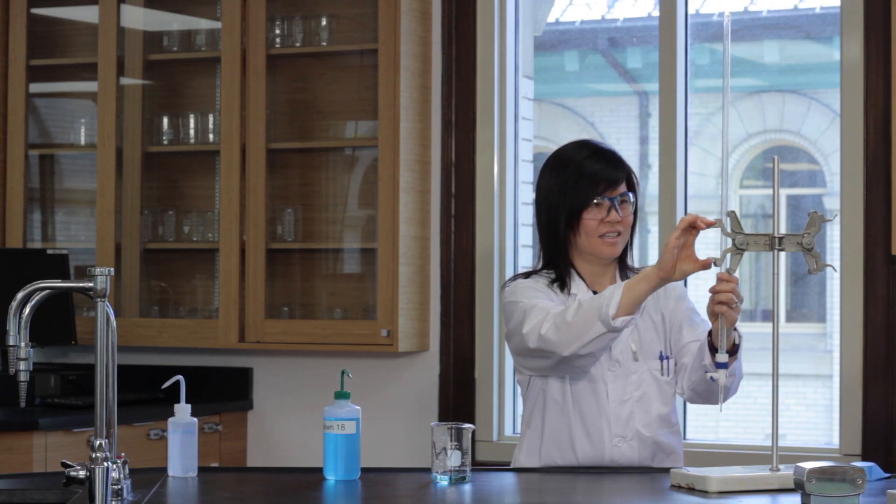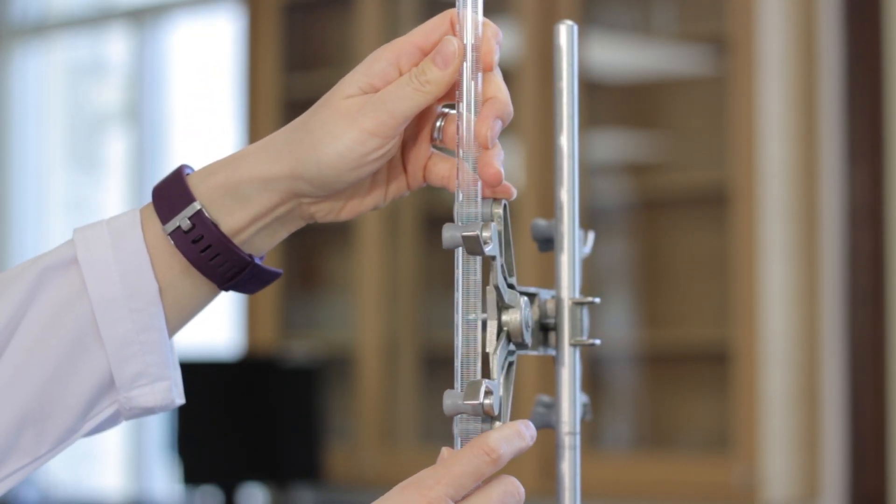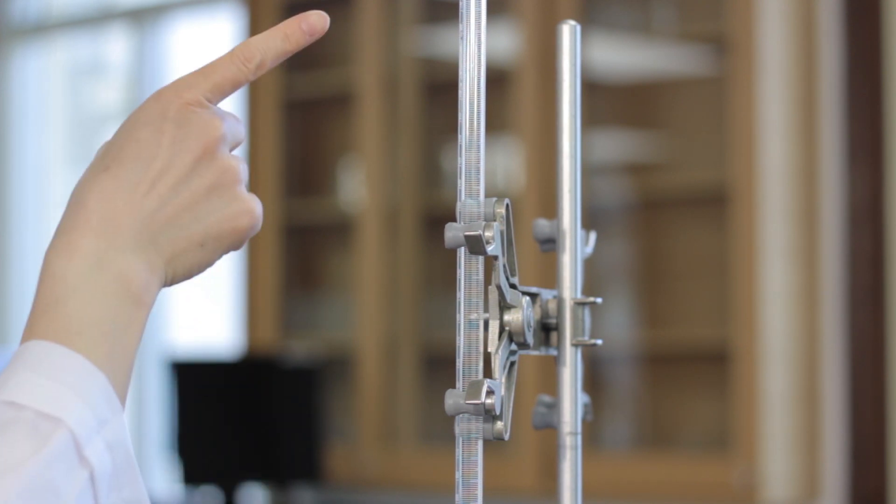Clamp the burette, ensure the burette is sitting properly in the grooves. It should be sitting straight up and down and not leaning forward or backward.